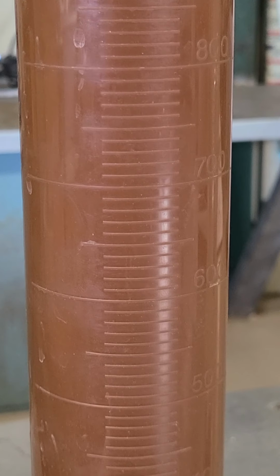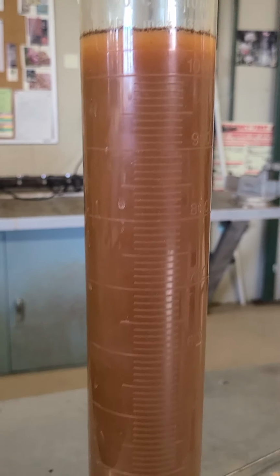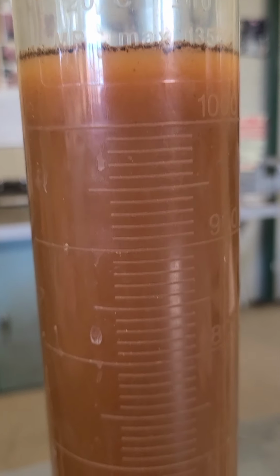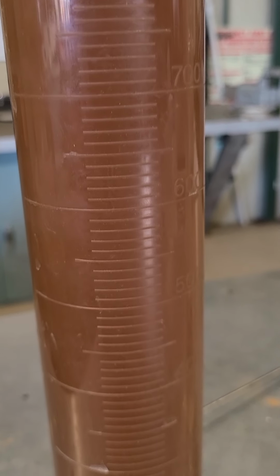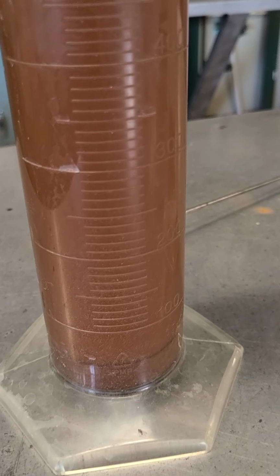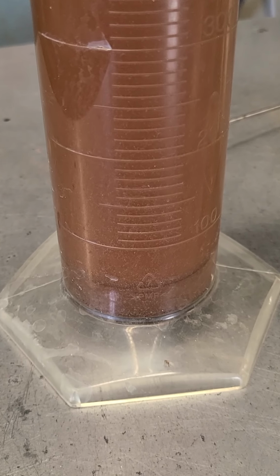So I'm going to go ahead and move back and show you this other sample, the other one here. I'll zoom back on that one. You can see on the top of this one that there's a little bit of clearing up there. It looks a little bit different, but pretty much all the way down this column, it looks pretty much the same. There's still a lot of material that's left in there after the 3 hour period. Let's go ahead and focus in on the bottom and see what we can see down there.